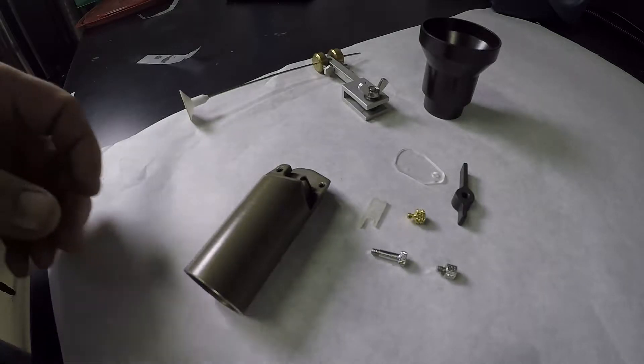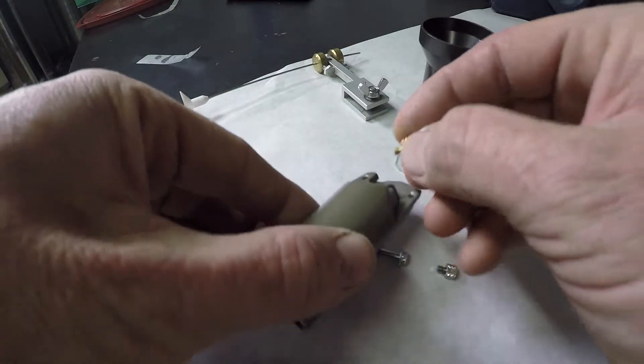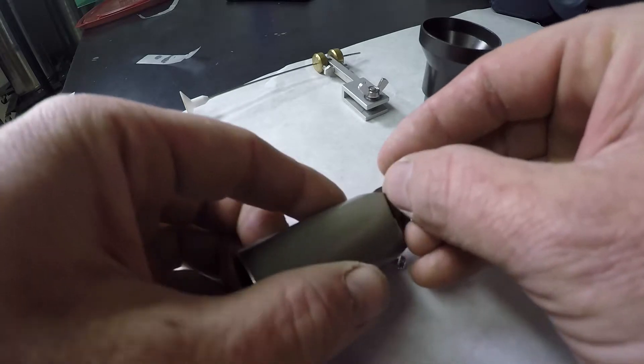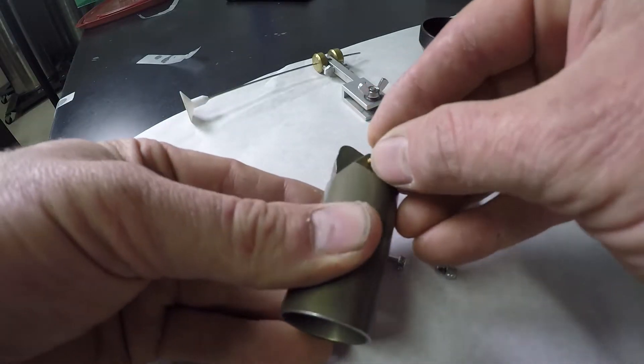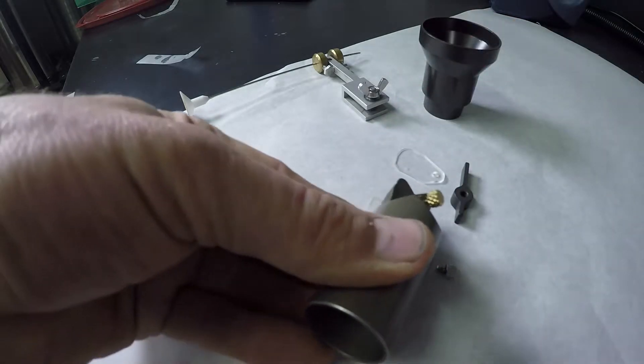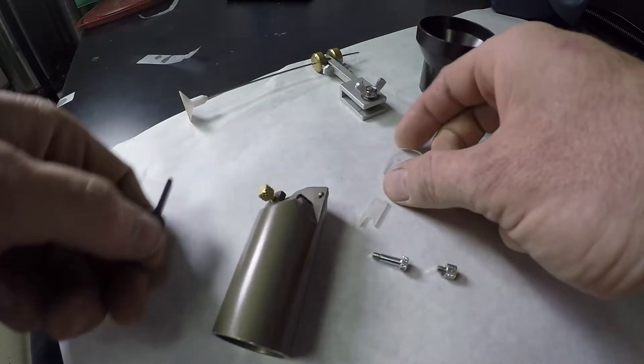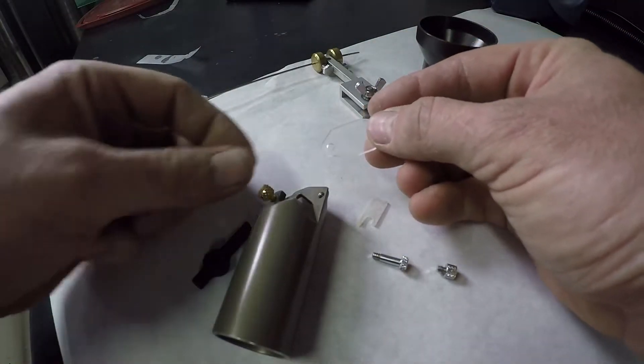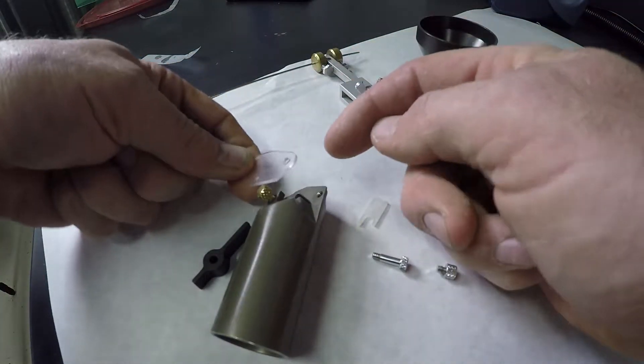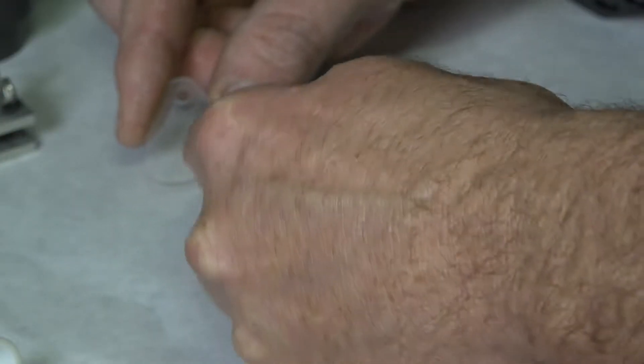Our little mini hopper for our sample: first thing you do is take this little set screw and put it in right there because that is going to be what holds our plastic shield into place. This goes in the front of the system. You don't want to tighten that all the way down yet. Now you have your little miniature ramp and then the side shield that goes on the miniature ramp. So the way this is going to orient is it's going to basically go in the back there, but you want the profile to match the profile on the aluminum ramp.